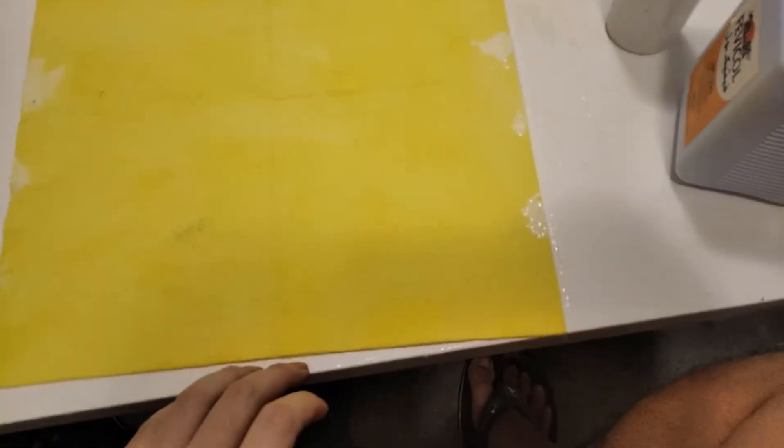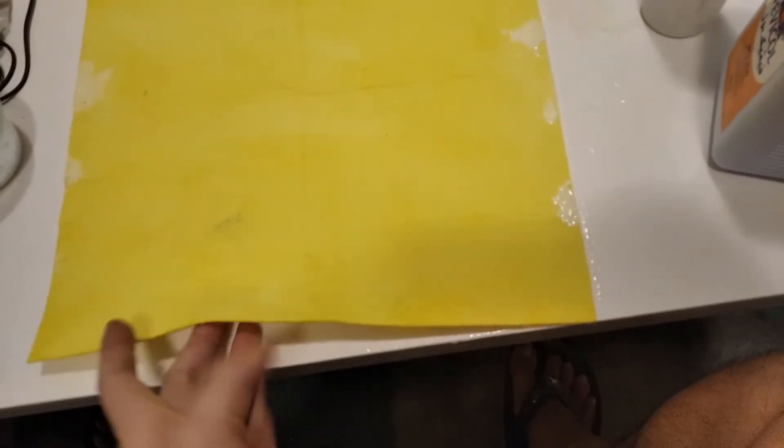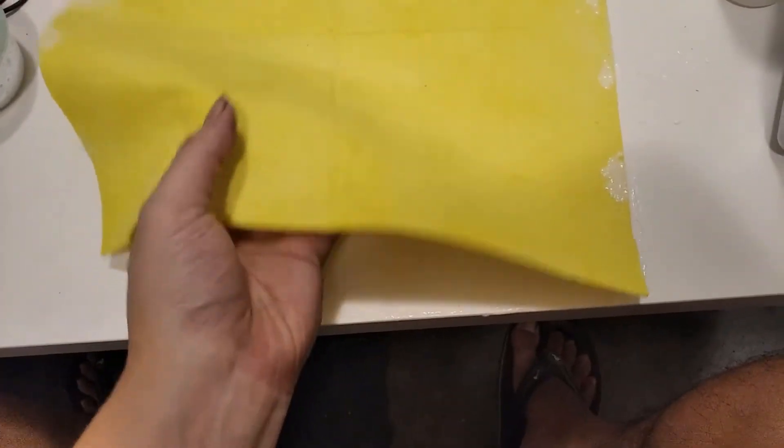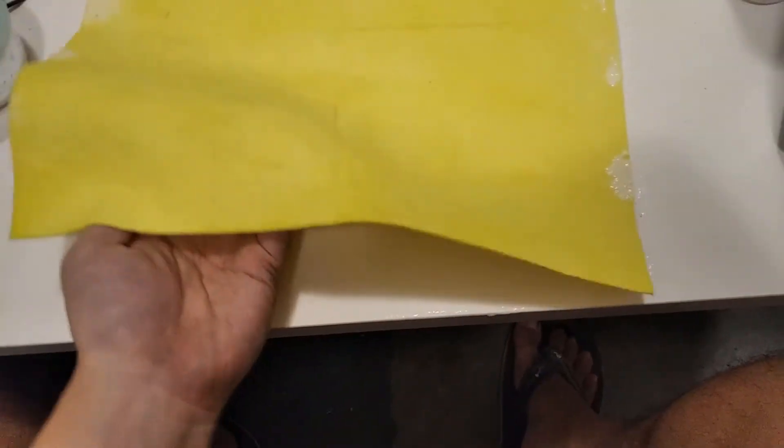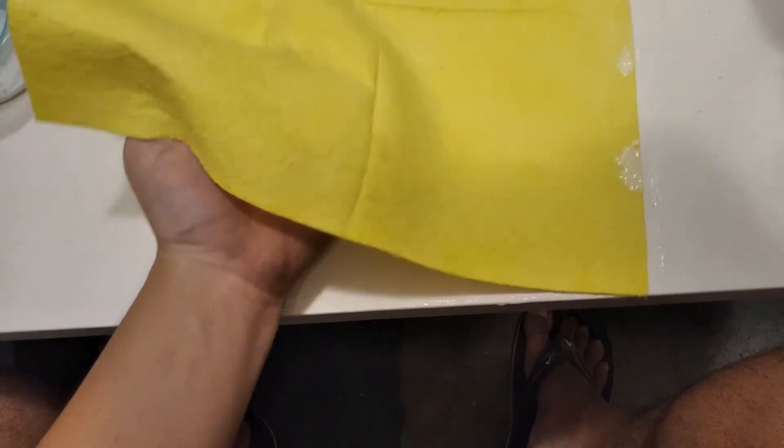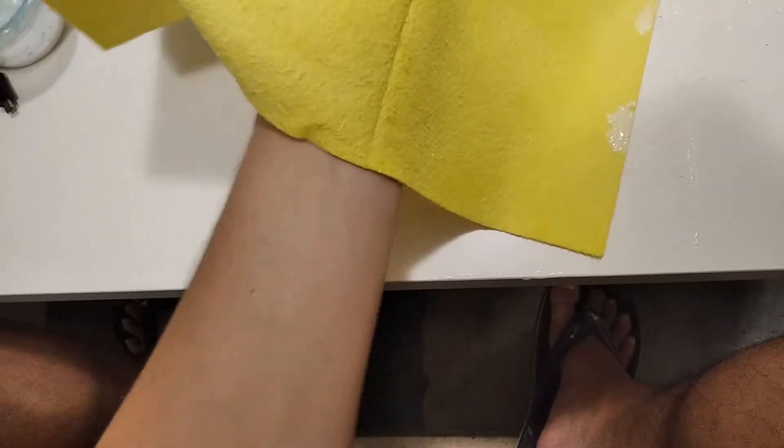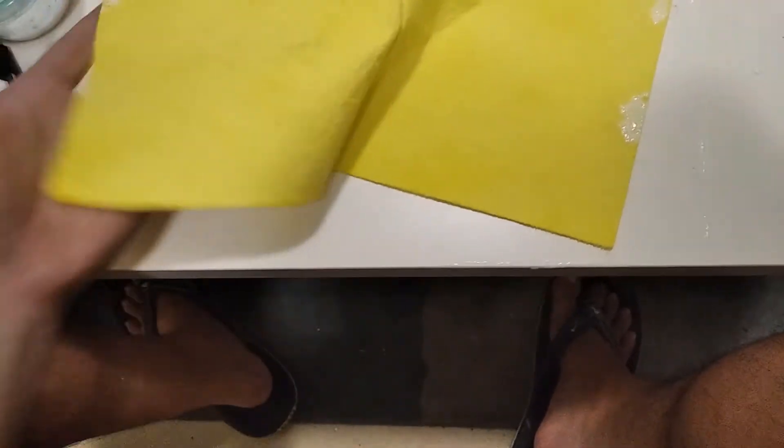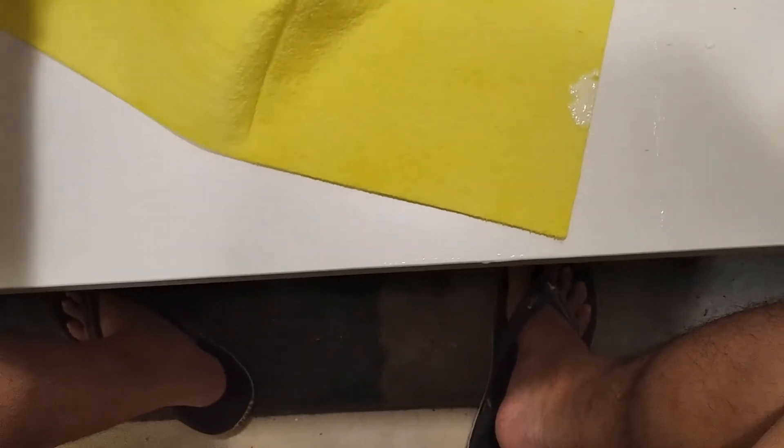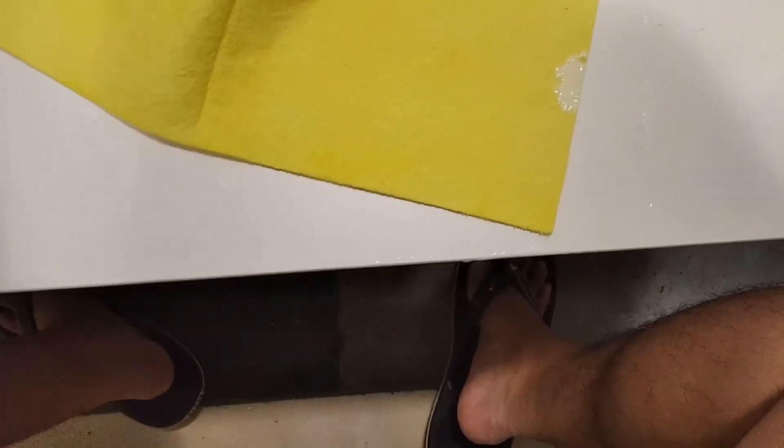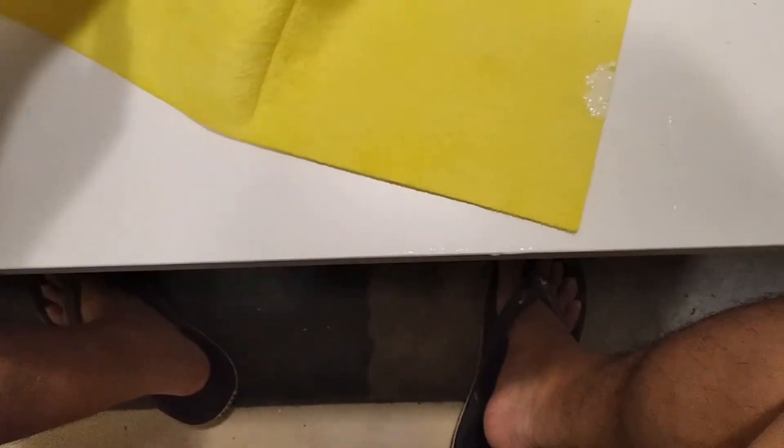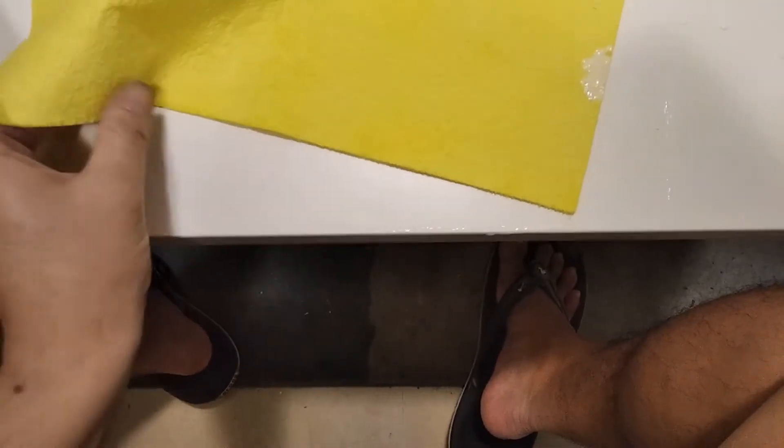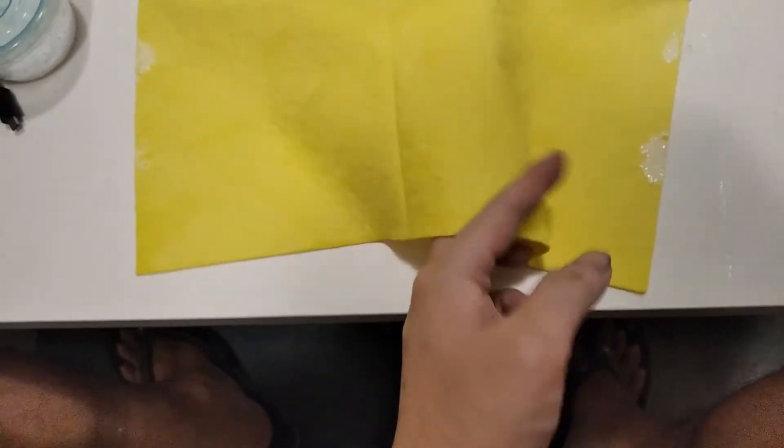Now that you've covered it, you have to first lift it up a little bit, just to make sure it's not sticking to the table. You just have to lift it up just a bit, then flatten it out again. Since most of it seems to not be sticking to the table, that's all good.